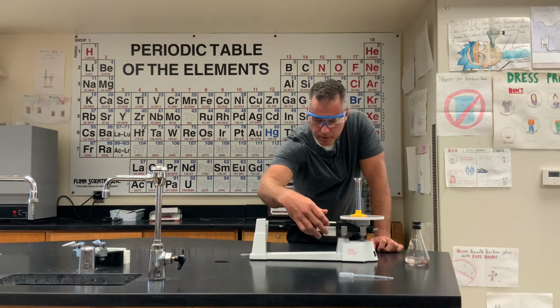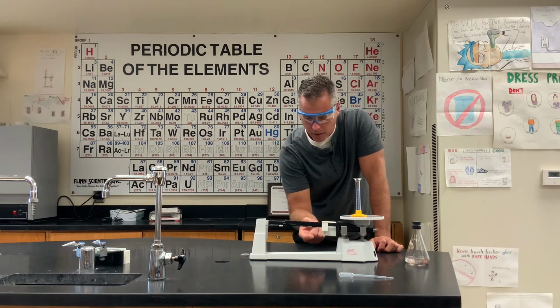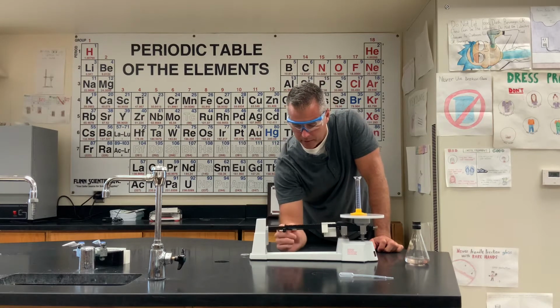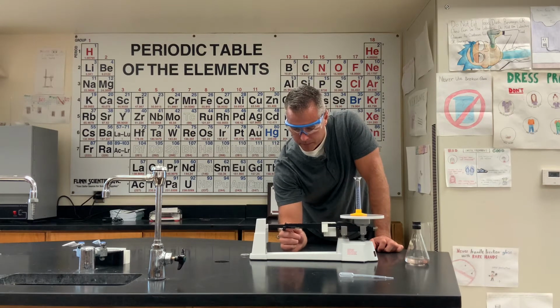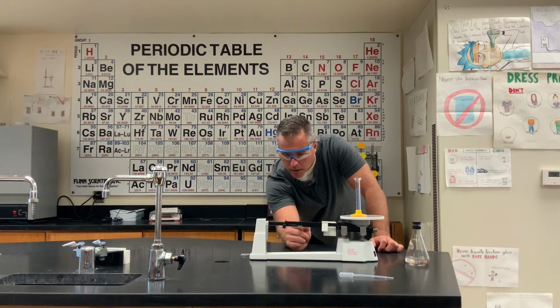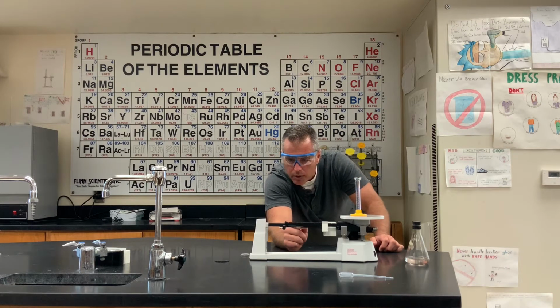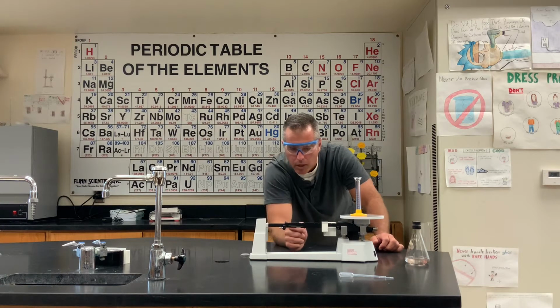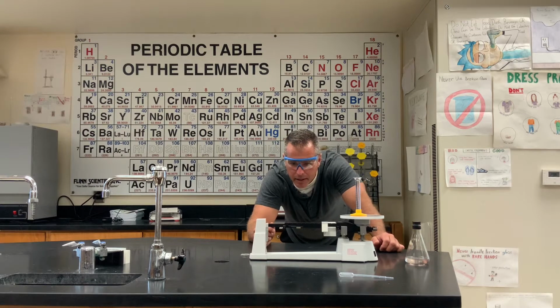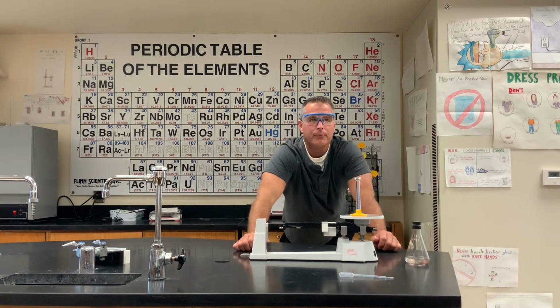Move this over, and make sure they all lock in. All right, we're looking at, we have 20. It is 28.00 grams.